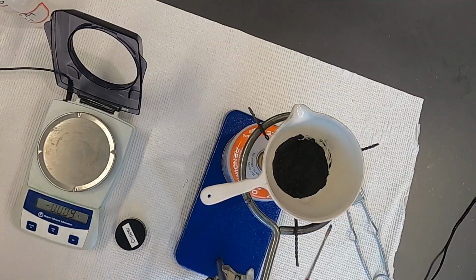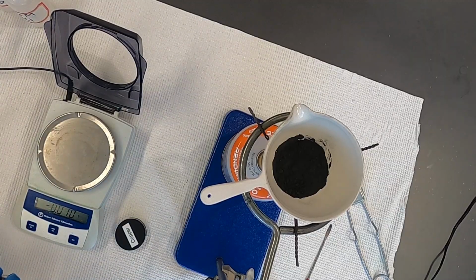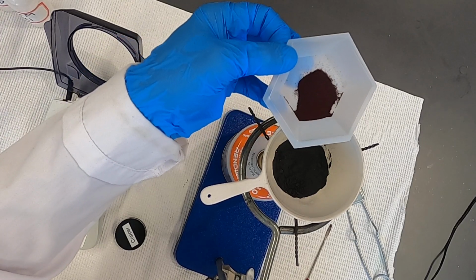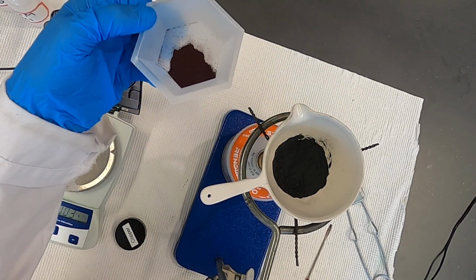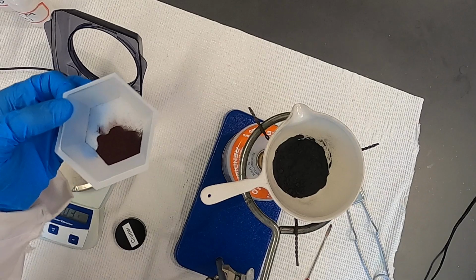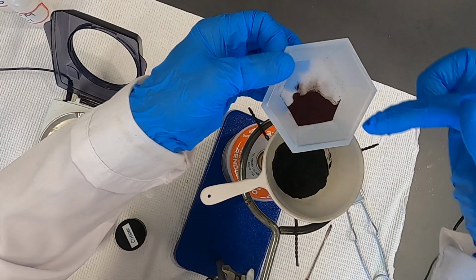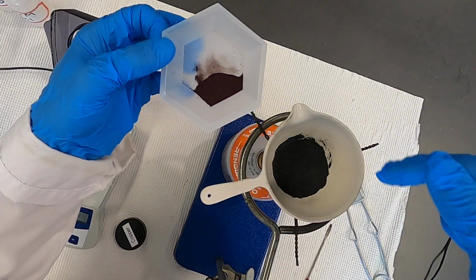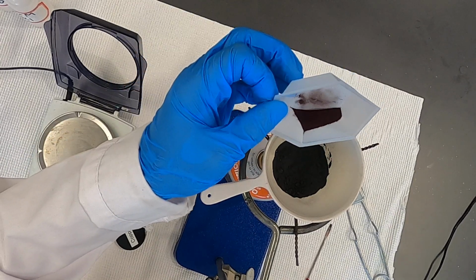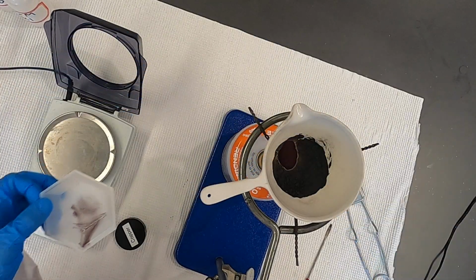And I'm going to demonstrate the color difference, if you can see it. This in my hand is copper, and what we've got is oxidized copper in the crucible. So you can tell that the copper was much more of a reddish color, and it's definitely a gray black for the copper oxide. So I'll go ahead and pour this right in here, see if we can see a contrast, and it might oxidize a little bit of that copper right before our eyes, and it is.